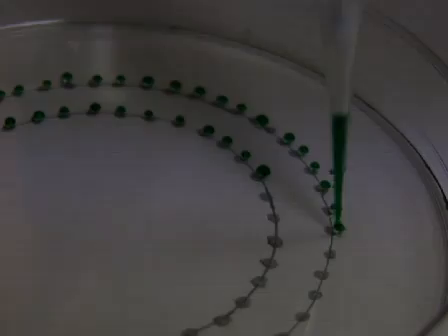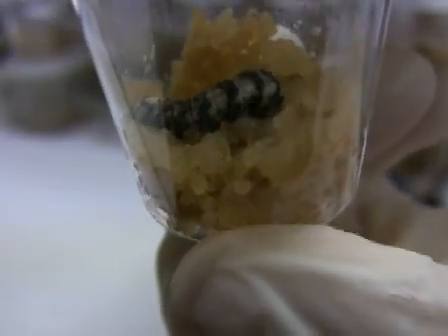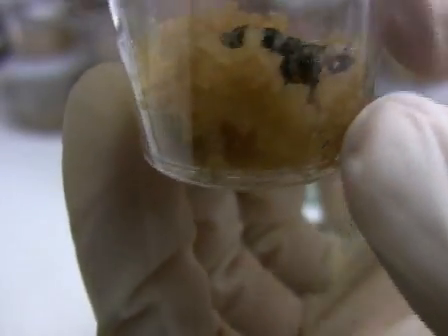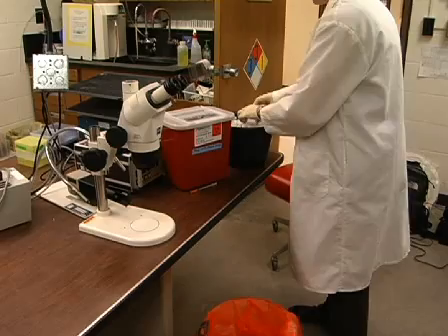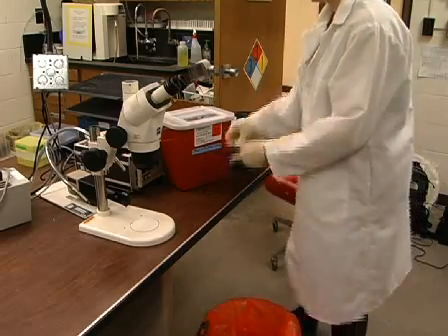We've just shown you 2 methods for infecting insects with baculovirus: the droplet feeding bioassay and the diet plug bioassay. When doing this procedure, it's important to remember that the cadavers of baculovirus-killed larvae are typically fragile and can easily rupture, releasing virus. So sterilize work surfaces and dispose of contaminated gloves and disposable materials in an appropriate manner to prevent contamination.